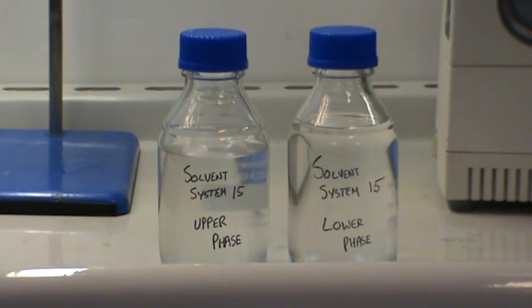You should be left with two almost identical volumes of solvent, one the upper phase and one the lower phase. Either can be used as stationary or mobile phase depending on which type of separation you're running. In this case the upper phase will be the stationary phase and the lower phase will be the mobile phase.